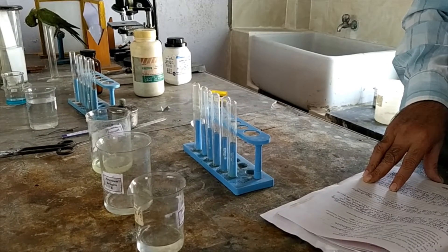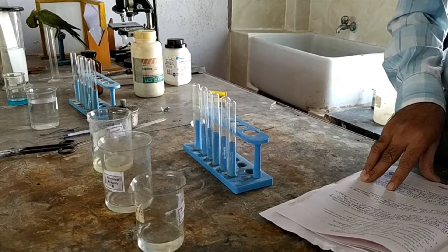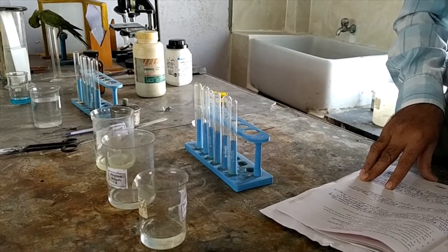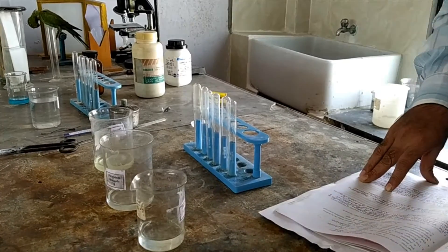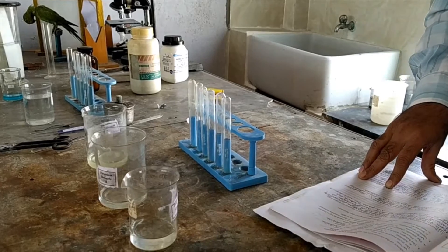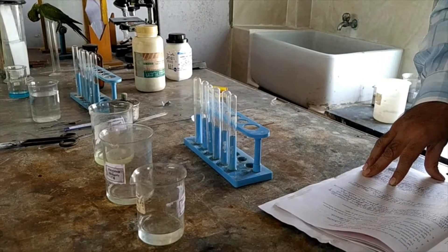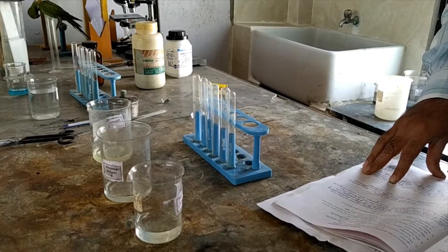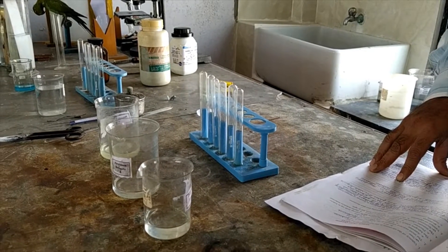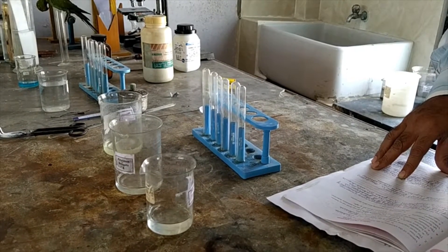Hello dear students, today I am going to demonstrate a science practical. We will start with Science 1, Practical Number 1. The aim of the practical is to identify the chloride, bromide, and iodide ions from the given salts.